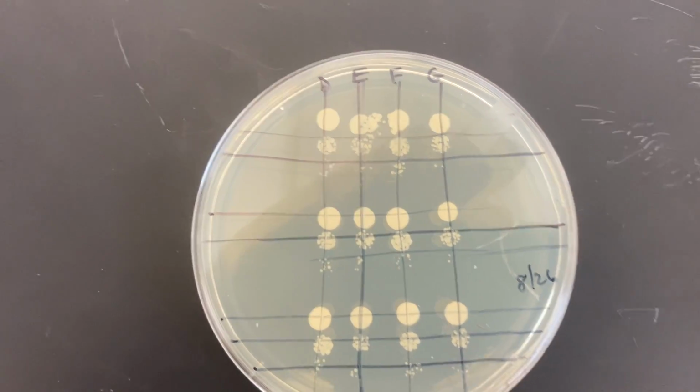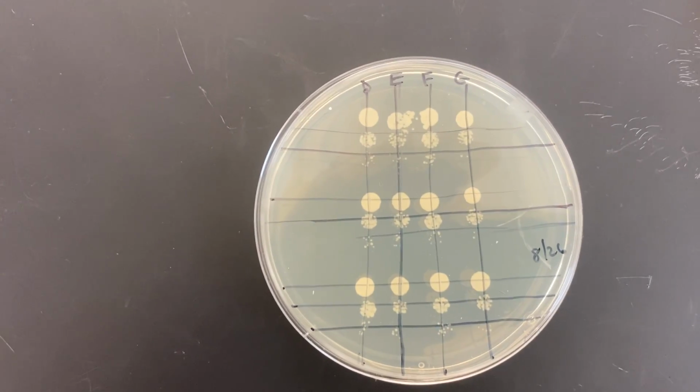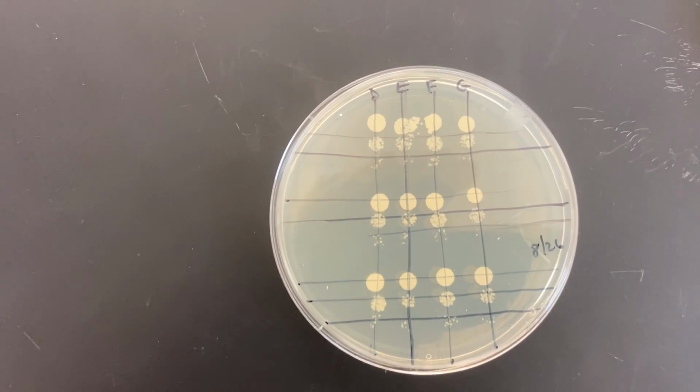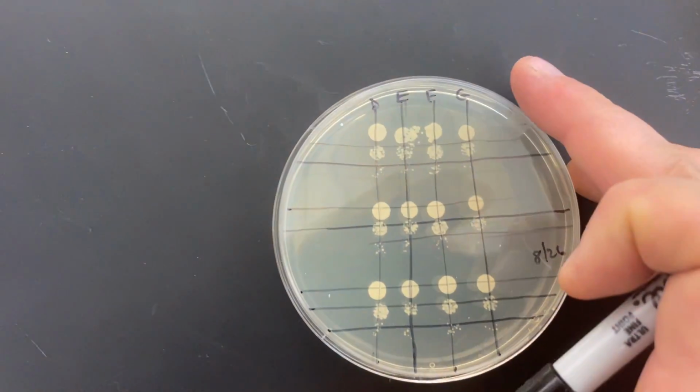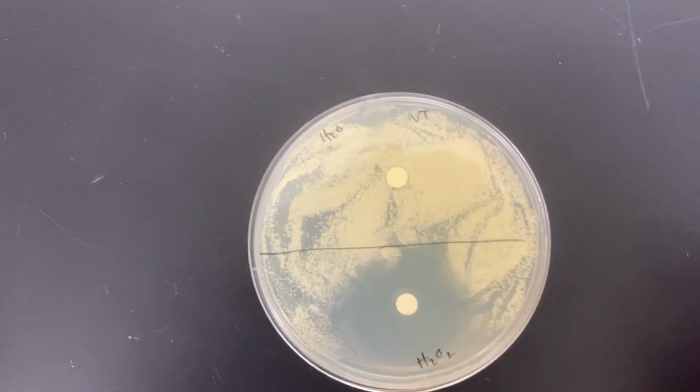This is actually a pretty robust way to compare cell performance or cell growth. So if you put roughly the same number of cells on there, you would be able to see them as being dense or less dense as they grow up, given they had the same amount of time to grow up. All right, so I didn't see a big difference on any of those. Let's move on to our oxidative stress test.